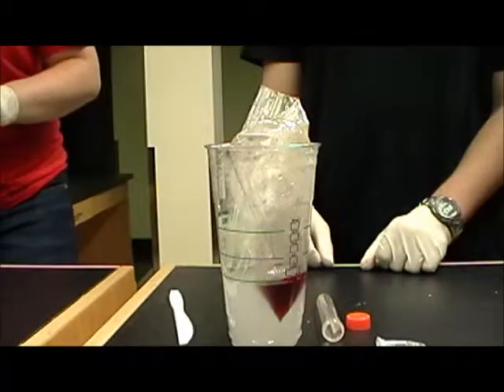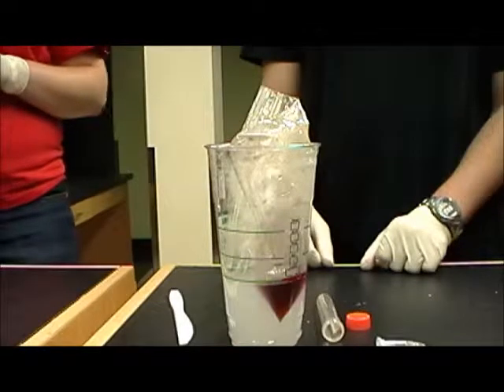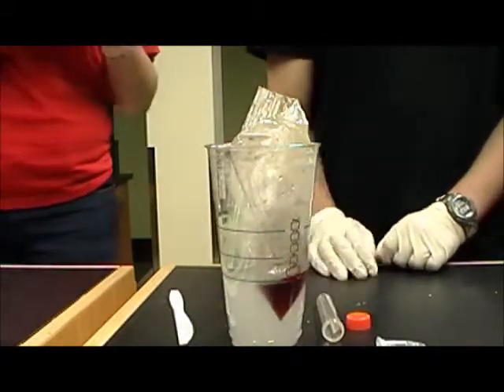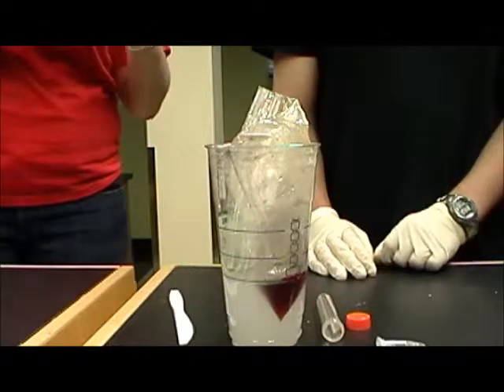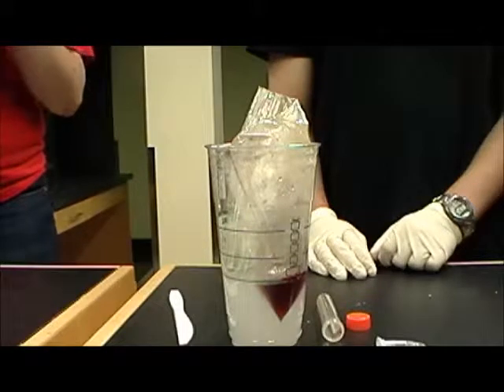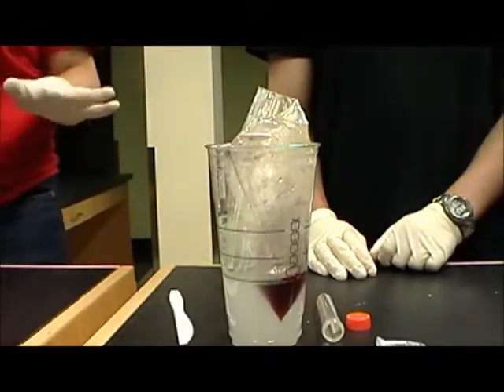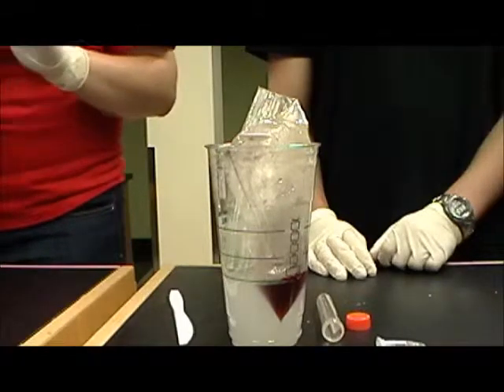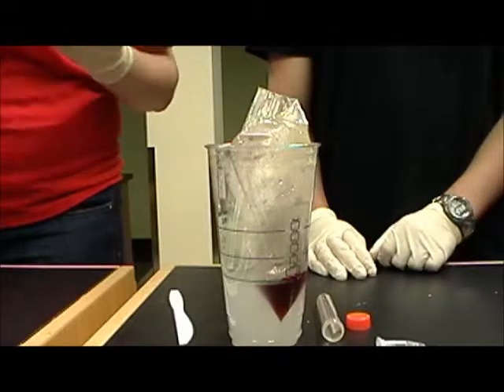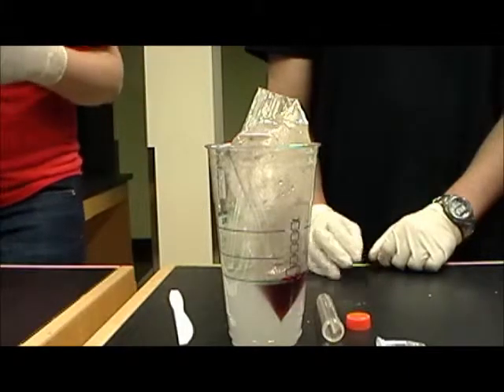So while they're waiting for this iodine to leave the bag and interact with the starch, you could have the groups discuss amongst themselves the answers to these questions and then maybe poll the whole class and ask them for some of their answers. Or you could have a whole class discussion on what they think might be happening right now. It's important to not give it away that the iodine is moving out of the bag and reacting with the starch. We want them to come to that realization on their own based on where they see a purple color develop.